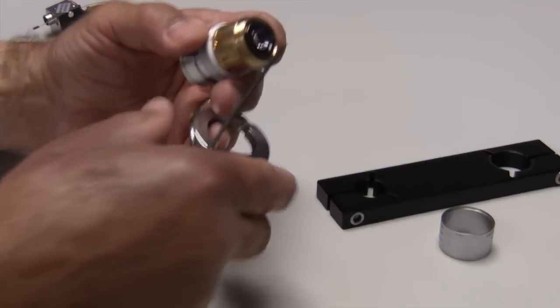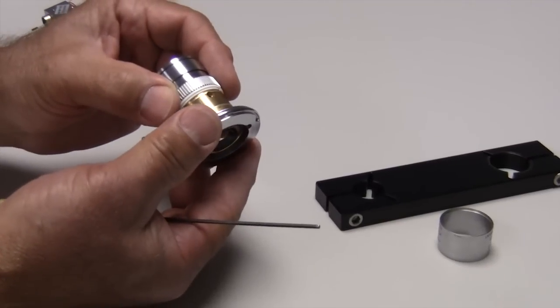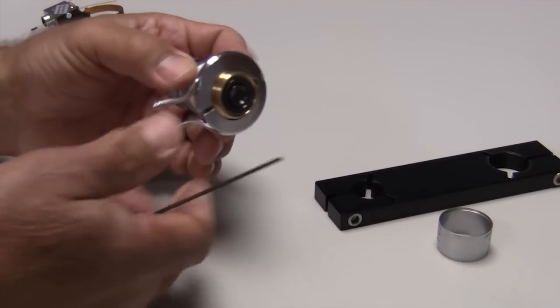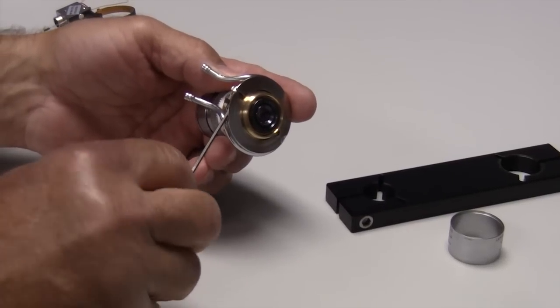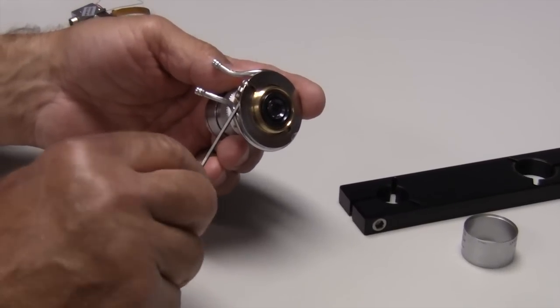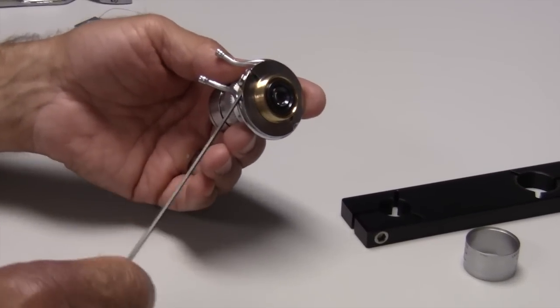This is the cooling ring. It simply slides over the bottom of the objective. You then have a set screw on the side that you put a 5/64th Allen wrench into and you snug this up.